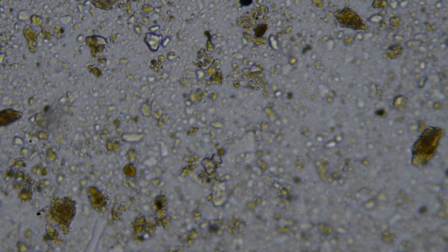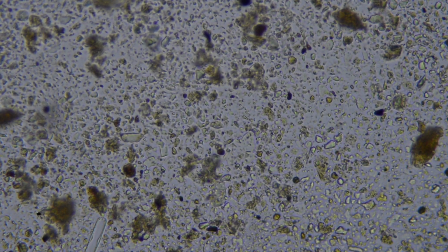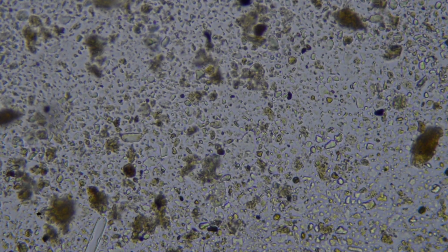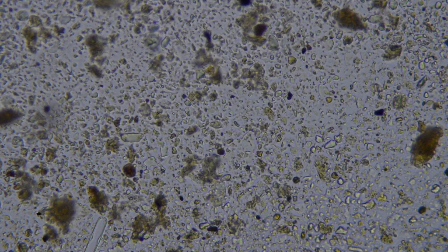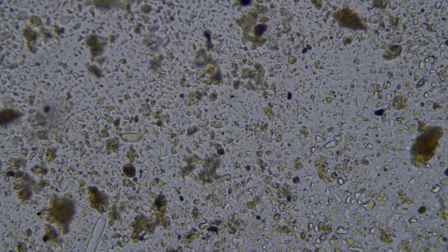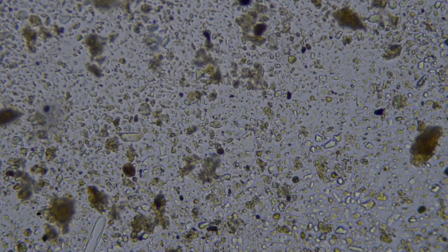So we're just having a look at the shapes. We want to see as many different shapes as possible. I'll explain a bit what we're looking at here. As I say, 400 times total magnification. Everything that you can see gyrating around like this are bacteria. We've got multiple layers of bacteria as I zoom in and out of the sample. You can see all that gyrating around, and they're actually moving through Brownian motion. Some of them have flagella and are moving under their own motive force, but a lot of them, something to do with thermodynamics and atoms, are just jiggling around, though I don't understand exactly how that works. But we've got quite a lot of bacteria, I would say.